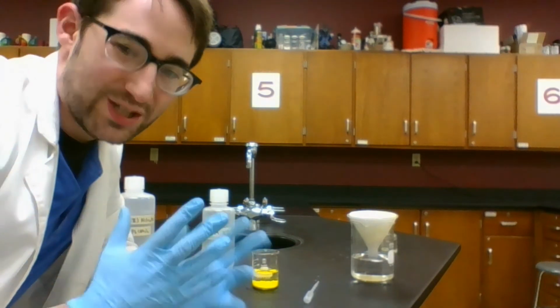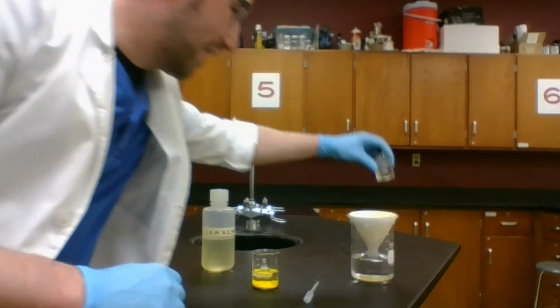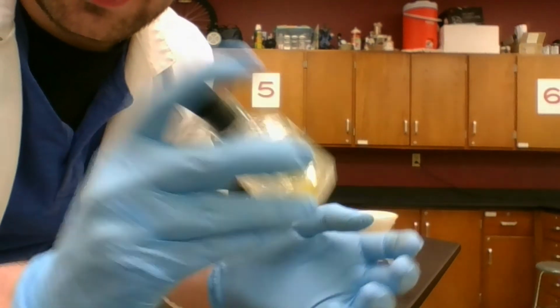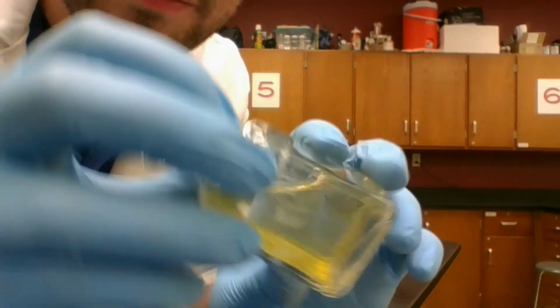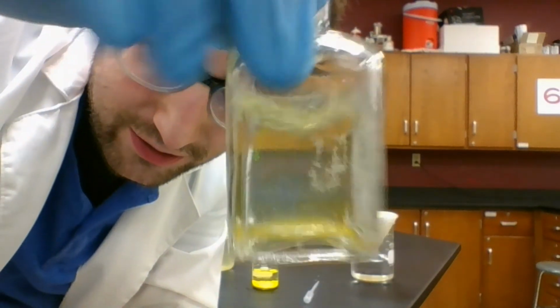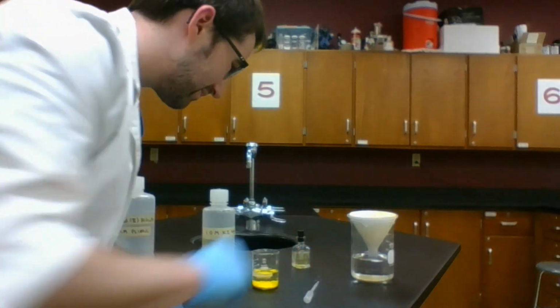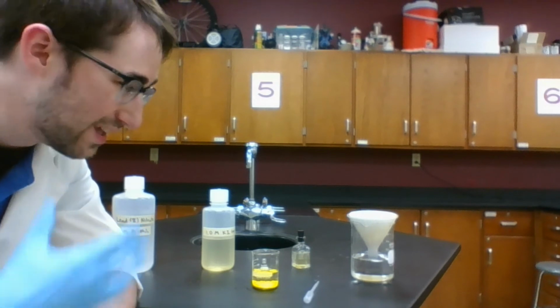If you do this in a small enough concentration, you can actually get a different version of this reaction. It's like these little sparkles. I wonder if this will show up. I can try and shake this a little bit. Got these little golden sparkles floating around in there. Just kind of cool. You can find some really cool videos and pictures on the internet of that. Mixing lead nitrate and potassium iodide to get lead iodide.